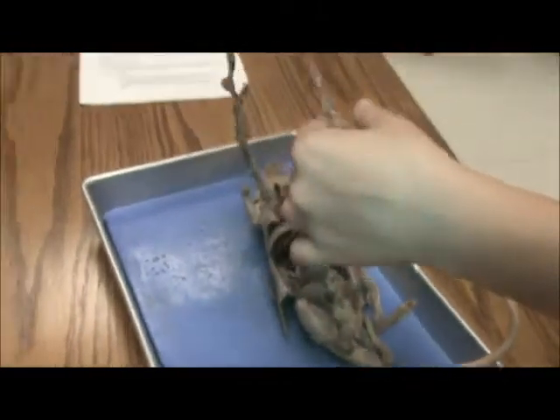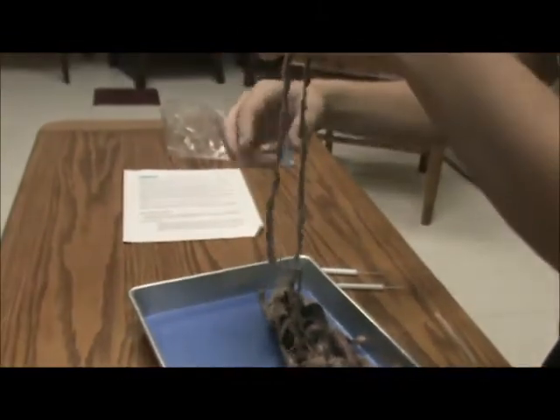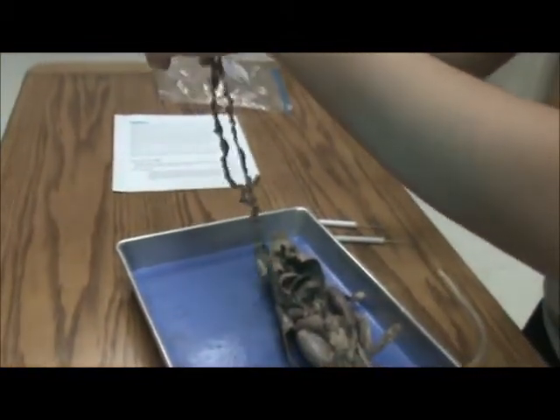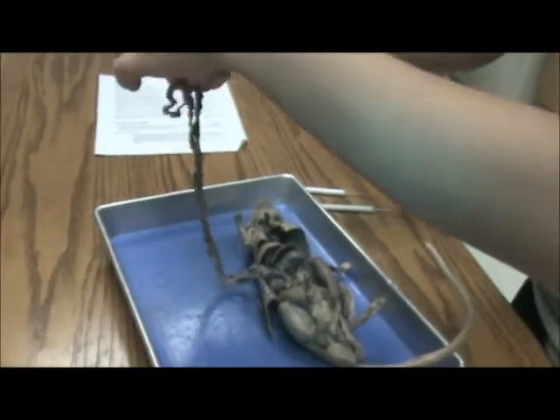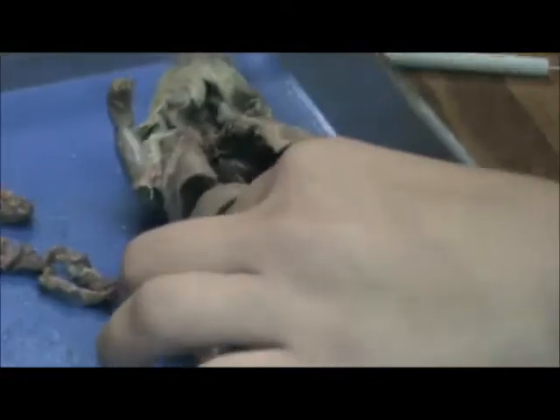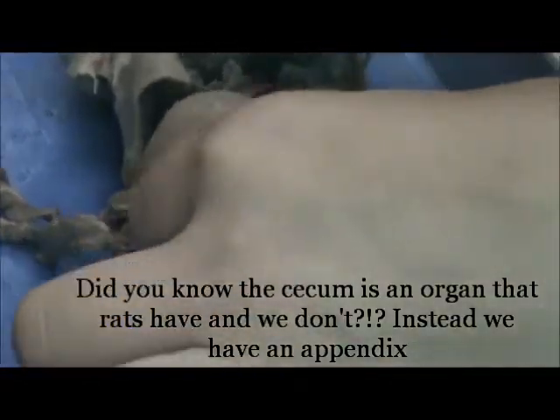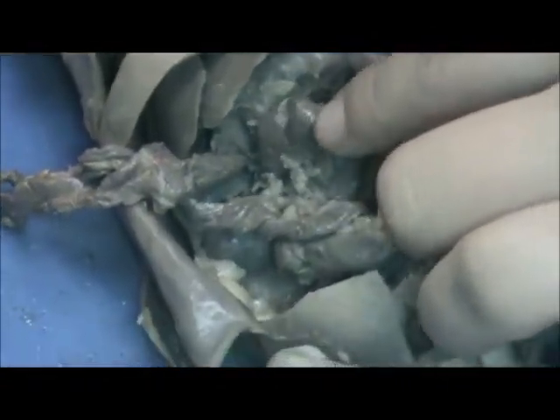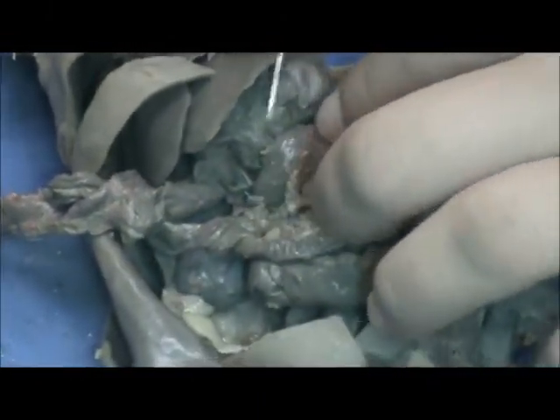After the stomach, it goes to the small intestine, which is this long thing here. The small intestine is longer than the large intestine, but it's smaller in diameter. The vast majority of the digestion and absorption of the food takes place here in the small intestine. The small intestine then leads to the cecum, which is like this part right here. The cecum is where bacteria is able to digest cellulose. The food in the cecum rots, and then byproducts can be absorbed by the rat.